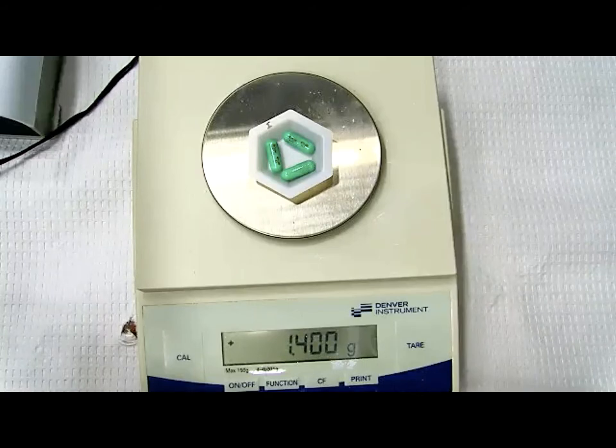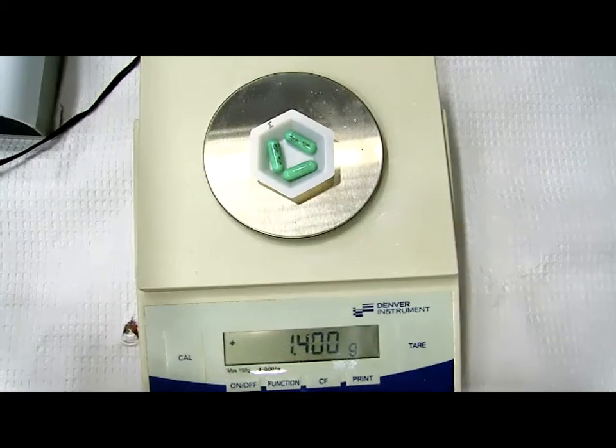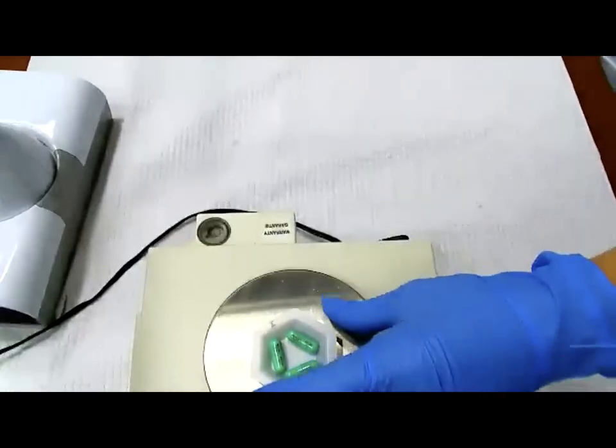Judy, do you want to tell us why? Well, we do not want the weight of the shell. We only need the weight of the contents inside the capsule shell. So what should we do? Does that make sense? The problem here is we are weighing not only the powder in the capsules, but the capsule shells themselves. So what we need is the weight of the contents only. So Judy will have to do that. What are we going to do?